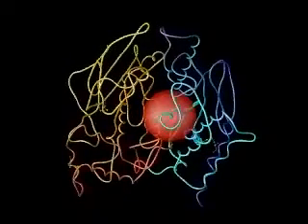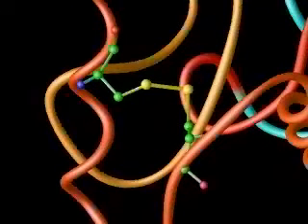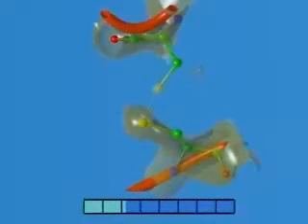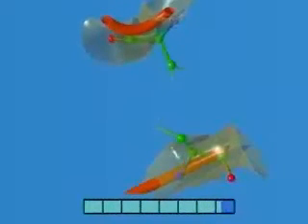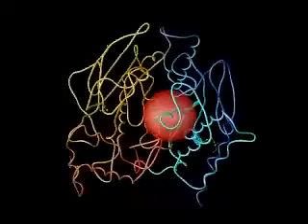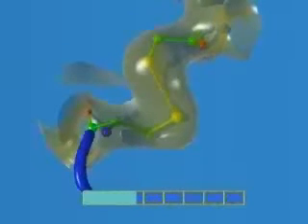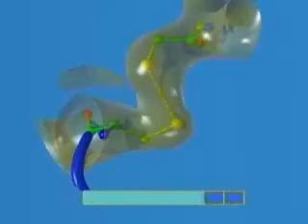First, let's examine this bond on the exterior of the protein. Here we see the actual change in electron density during the course of the experiment. This disulfide bond disintegrates within the first few minutes of exposure. Now let's examine a bond deeper inside the protein. Surprisingly, this bond isn't affected. This disulfide remains intact for the duration of the experiment.